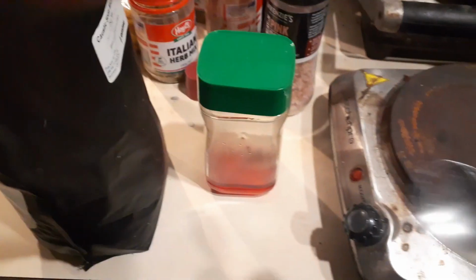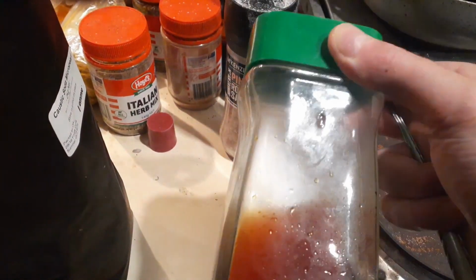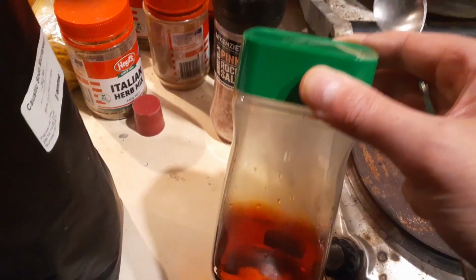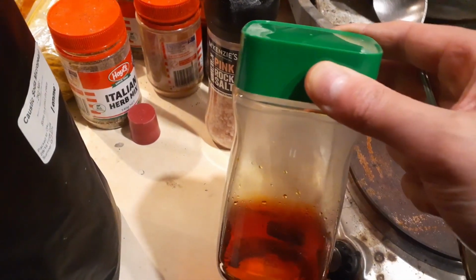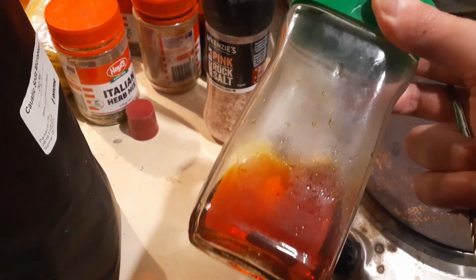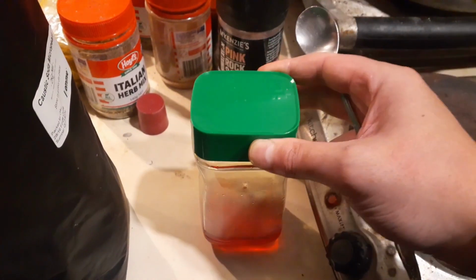Alright, so I have sodium hydroxide. I believe you can use other hydroxides, and I've also got a spoon here. It's been bubbling up. You can see it's kind of got some condensation. What I'm going to do is put a bit of water in there, and pour the water off into another jar, and collect the metal because I don't want the metal, and then I'm going to put the water back and put this liquid back in here, and I'll show you what that looks like.